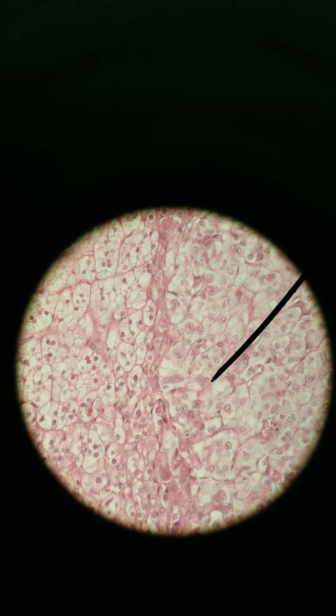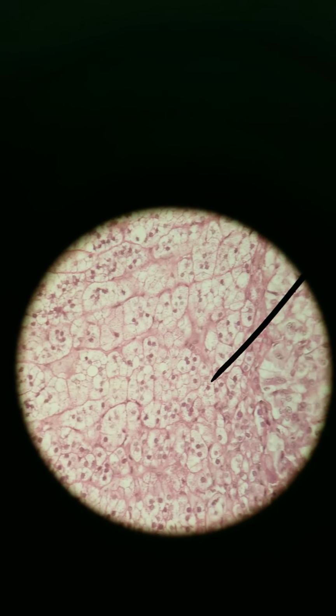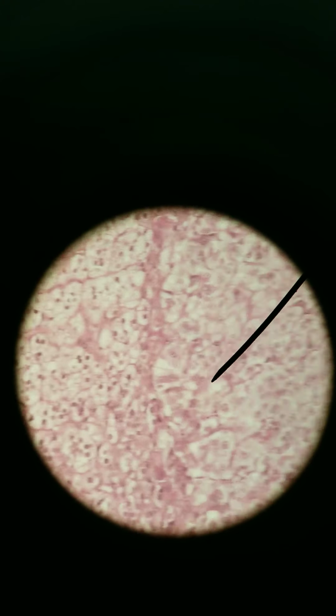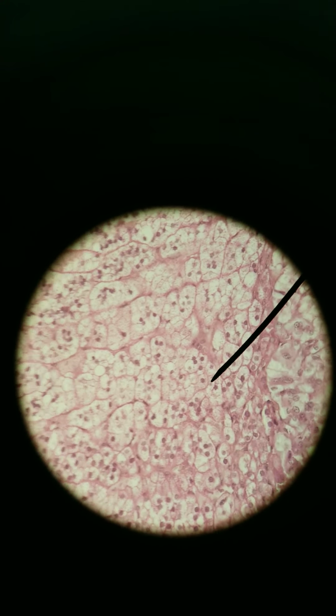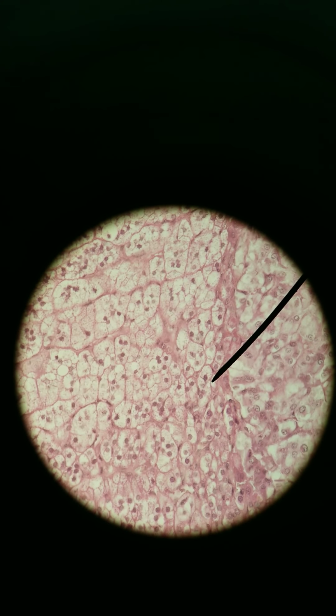All right, here's that division. So these are chromaffin cells. Starting from here to here, it's not that, it's kind of a gradual transition. There's no hard line. We see a hard line here, but we don't see any more hard lines as we go through.